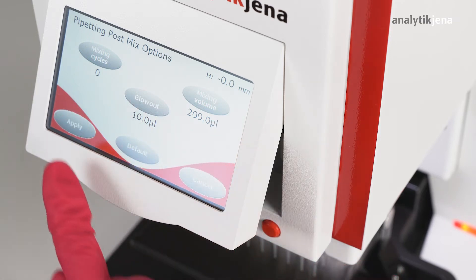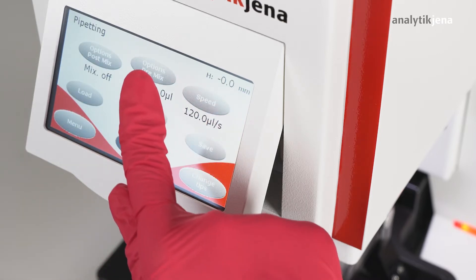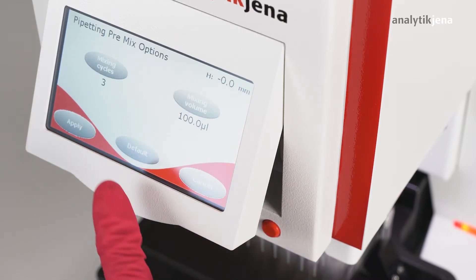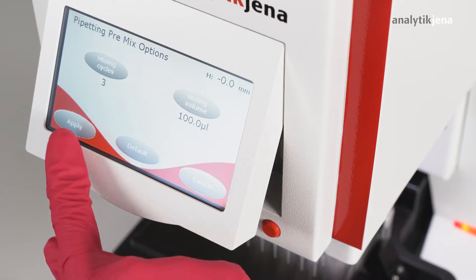For the pre-mix, we choose 3 mixing cycles and a mixing volume of 100 µL. For the transfer, a volume of 200 µL is chosen.